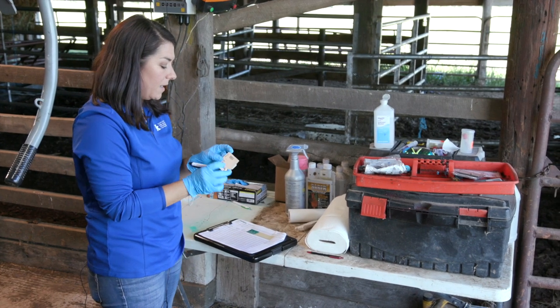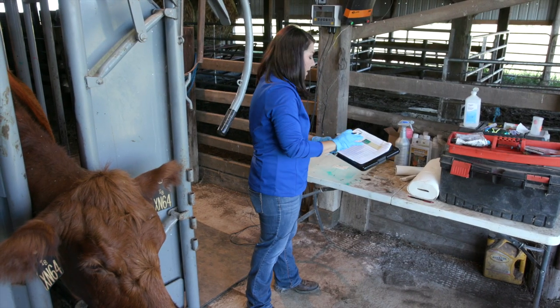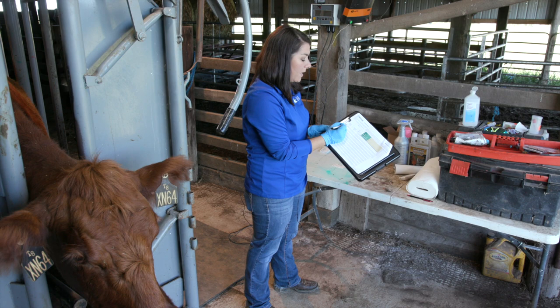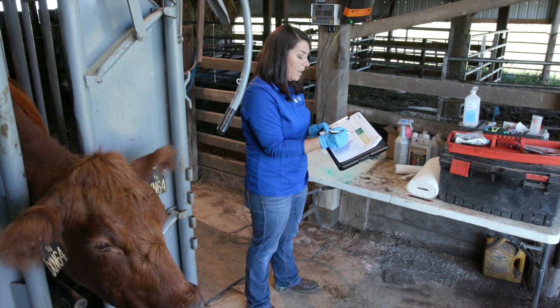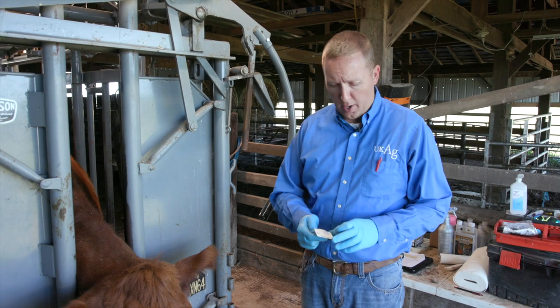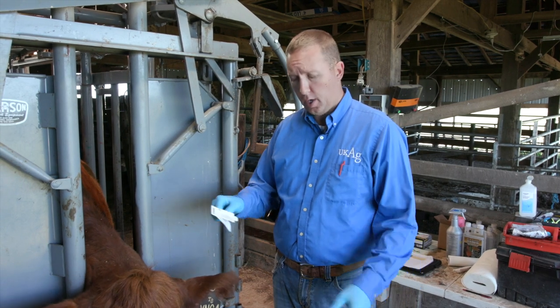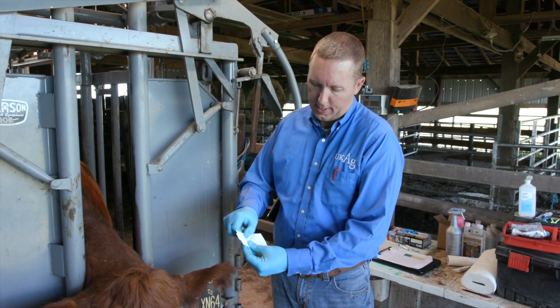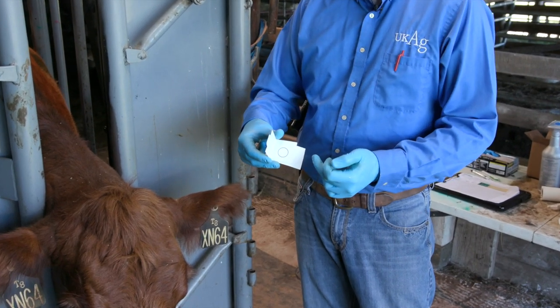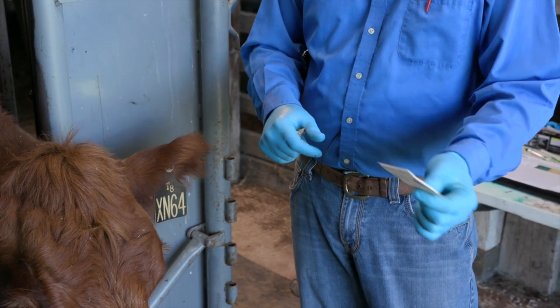We have the DNA blood cards here. On the animal ID I'm going to write down XN64, and then I'll correspond that same number over to the record sheet that we'll turn in when we turn in the DNA test. I'll write the sample type and fill out whatever information they want from that DNA sample — this is where an extra set of hands is nice. We have a blood card, and we're going to fold the top back and crease it, then pull it back over until we're ready to use it. The main thing is the absorbent paper with a target on it — we don't want any dirt or debris on it, so we'll keep that closed until we're ready.